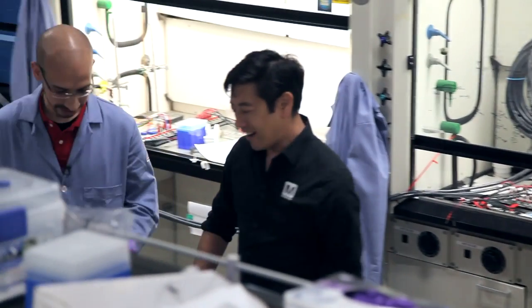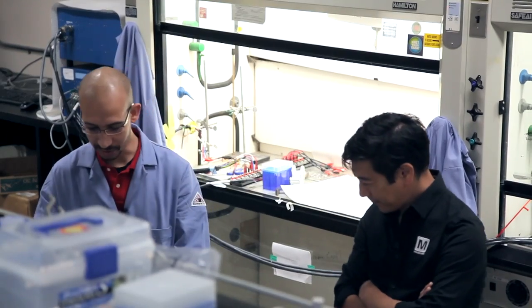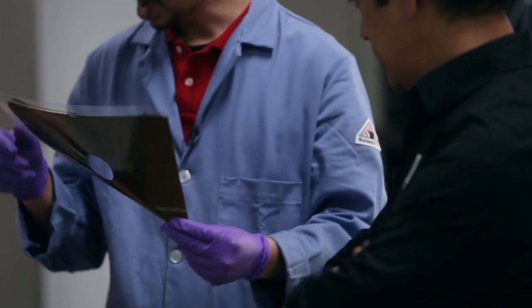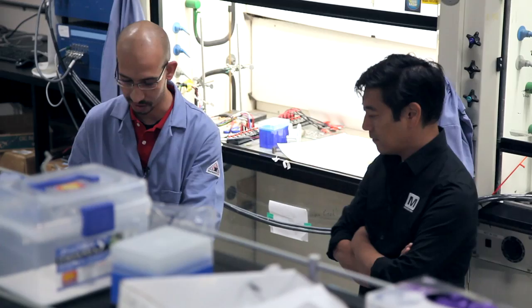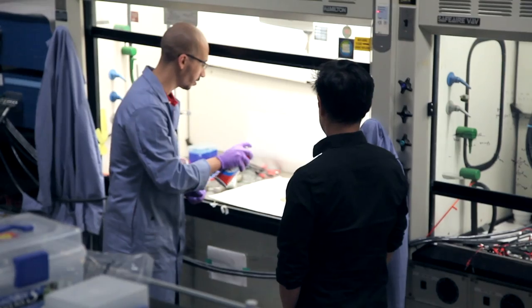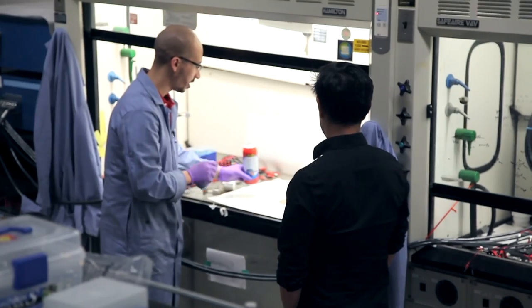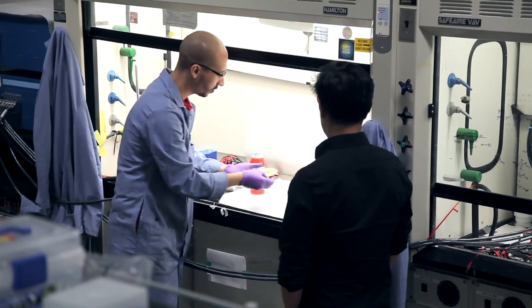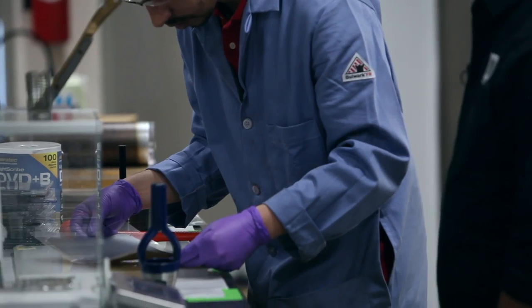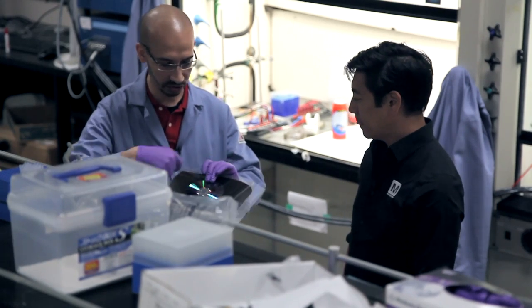All right, half an hour in the oven and we are ready to go. Now what I'm going to do is punch a hole in the middle — perfect hole. And now I need to put it on a CD. I'm going to take this and I have a spray here. Now this is ready. I have some glue on the surface, so I'm just going to apply it right in the middle. The next step is basically to cut off the extra on the edges.